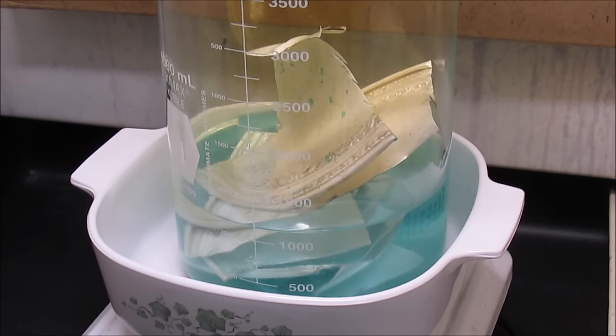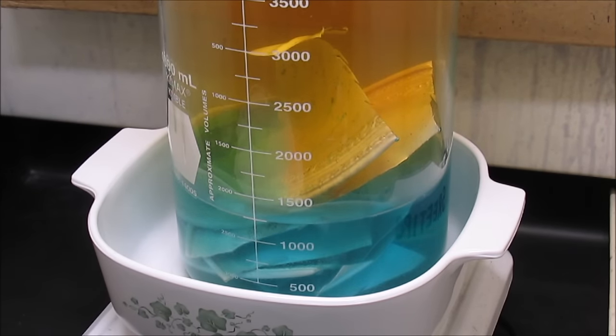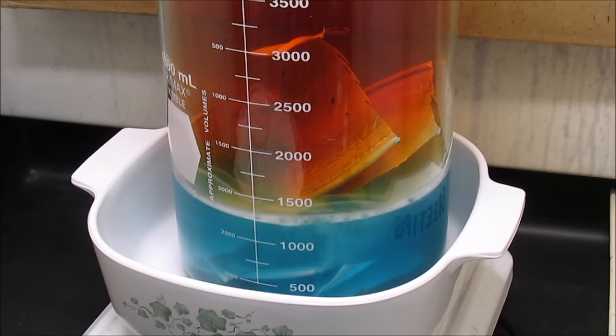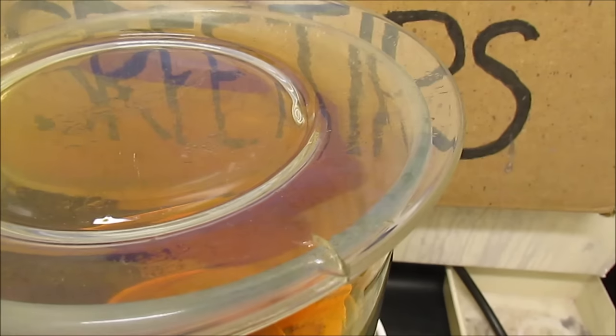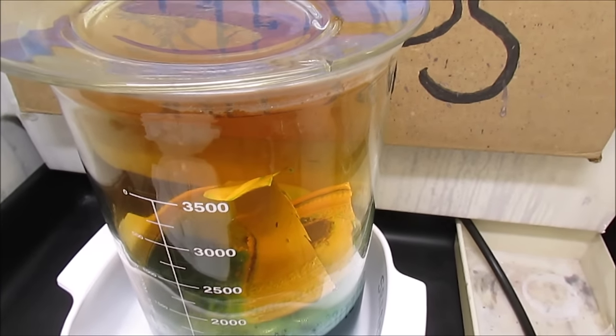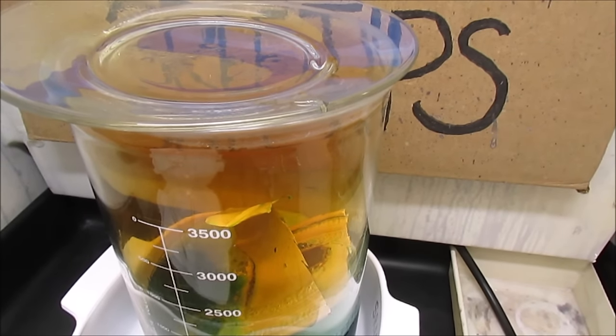This is about a 15-minute segment of footage sped up 16 times, and you'll notice that the solution is turning blue, which is an indication that copper is going into solution. Here's an example of the reflux reaction: by having that cover on top of the beaker, the brown gas condenses on the cover and forms additional nitric acid that drips back down onto the metal, improving the efficiency of the initial dose of nitric acid added to the beaker.